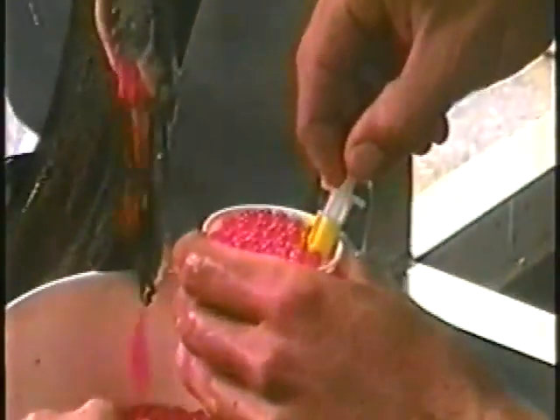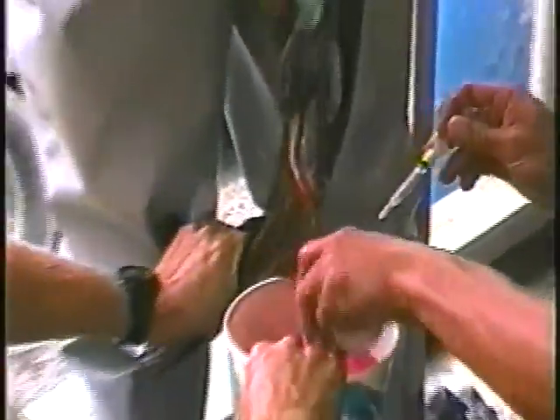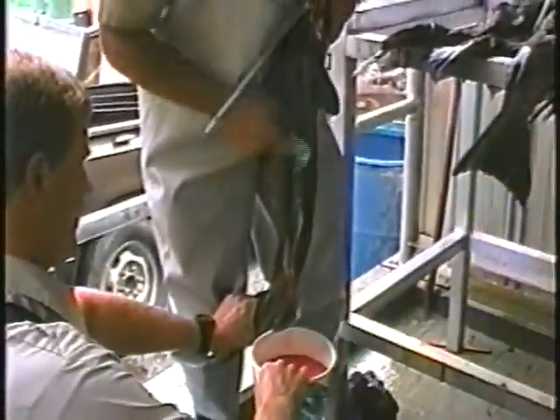If testing adult salmon, the sex fluids are generally collected at spawning. When spawning the female, a portion of the eggs and fluid are expressed into a clean cup and at least 1 ml of the ovarian fluid is collected. An easy method is to draw the fluid into a 3 to 5 cc syringe without a needle. The syringe cap is left on to exclude drawing up eggs.